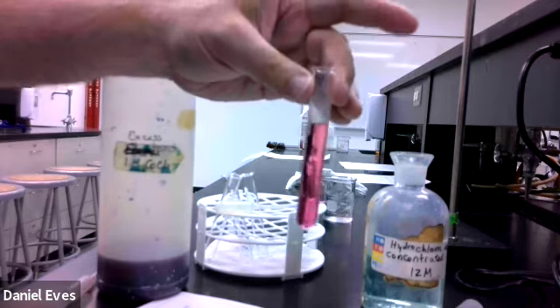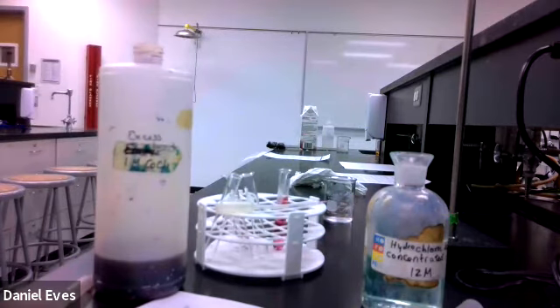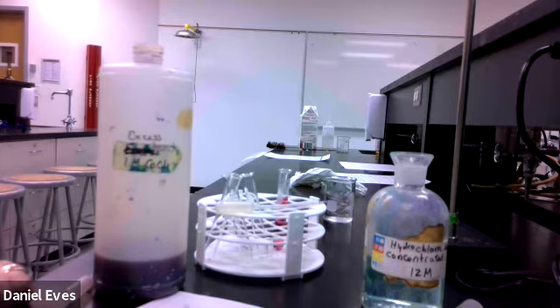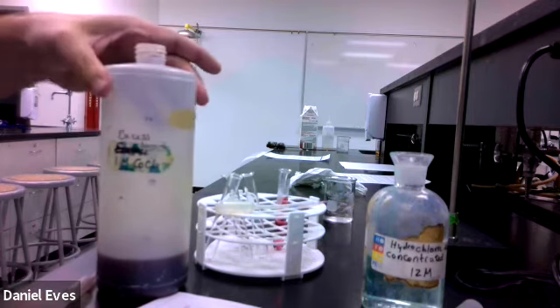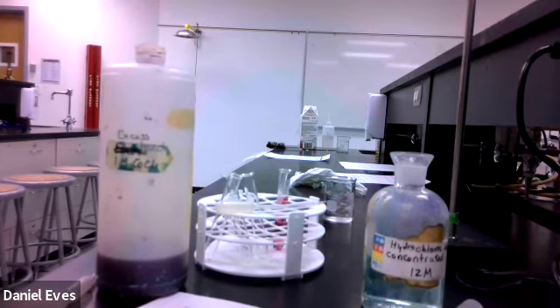So what we're going to do is take 3 different setups, and we're going to set them up with the exact same concentrations of everything. So it was about 15 drops of hydrochloric acid. So let's go ahead and put our 1 milliliter of cobalt chloride in 3 separate test tubes, and then we're going to put them at different temperatures. So one at cold, one room temperature, and one hot, and see if we can determine whether or not this process is endothermic or exothermic. So I'm going to set that up and I'll come right back.